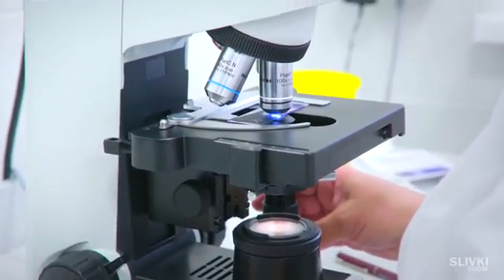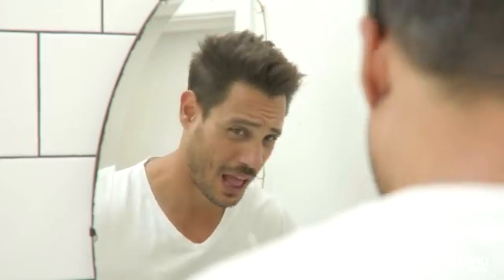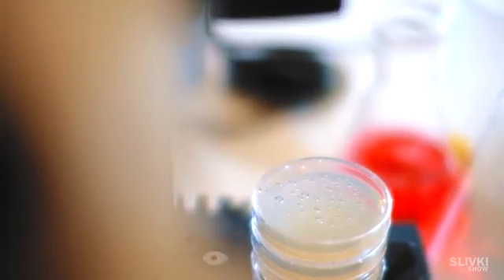Hey, now you will find out how toothpaste, bird feathers, and most importantly the human sperm looks like under the microscope.